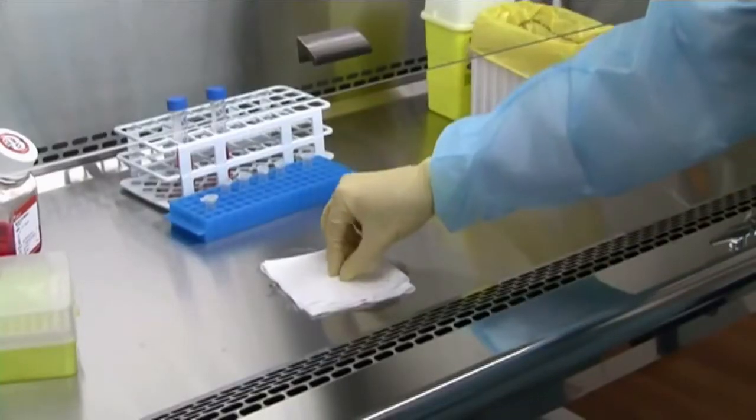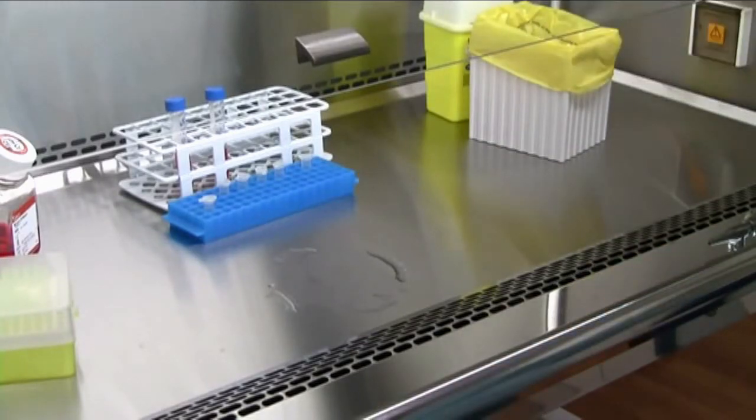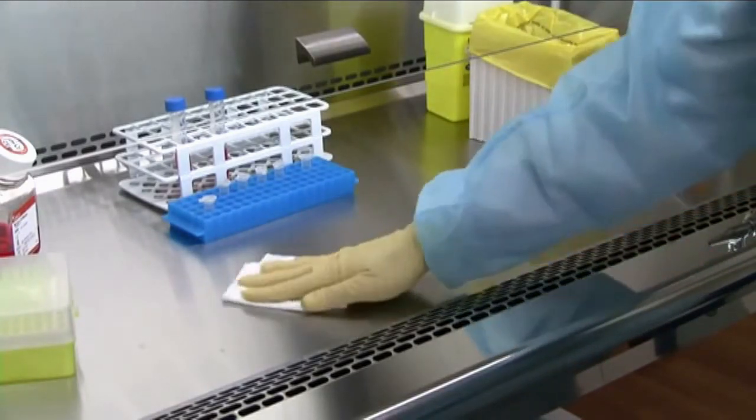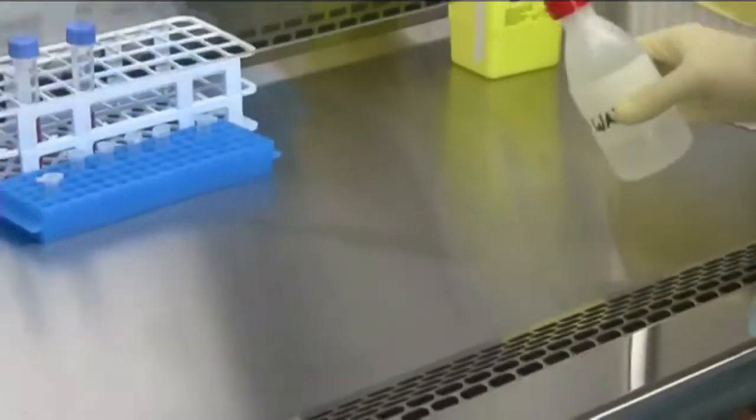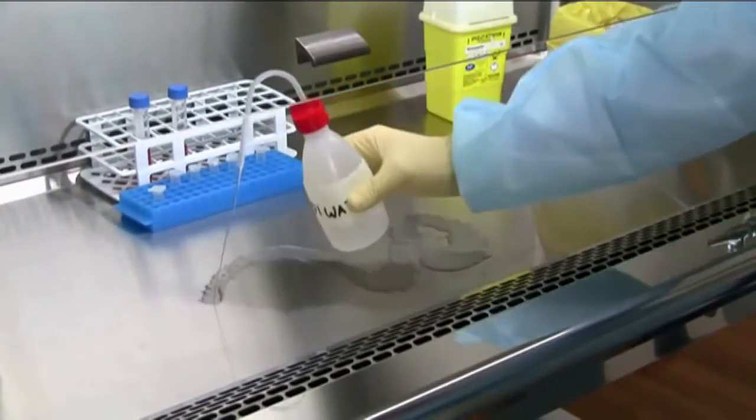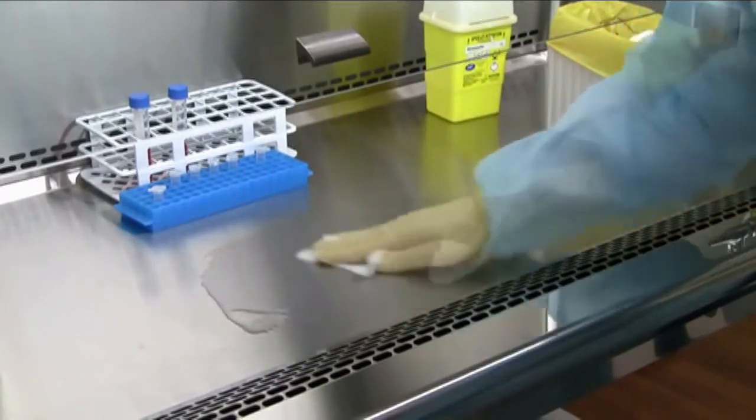After allowing 15 to 30 minutes for contact time, wipe the surrounding exposed surface and equipment with appropriate decontaminant. Contact time will depend on the microorganism and the decontaminant. Remember to clean the bleach using sterile water afterward as it might cause discoloration on the stainless steel surface.